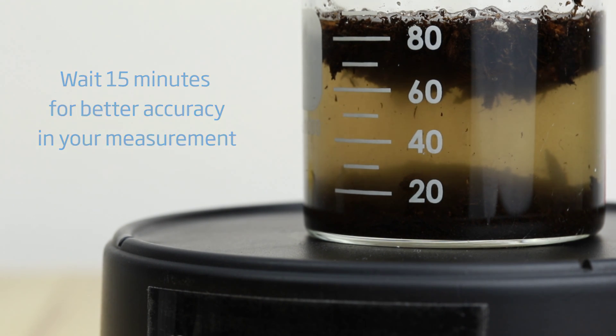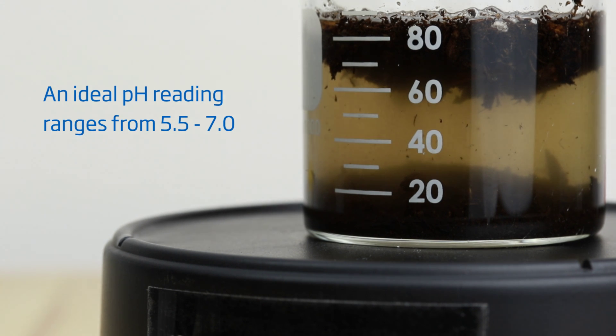With your sample now stirred and settled, immerse your electrode into the sample and wait for a stable reading.